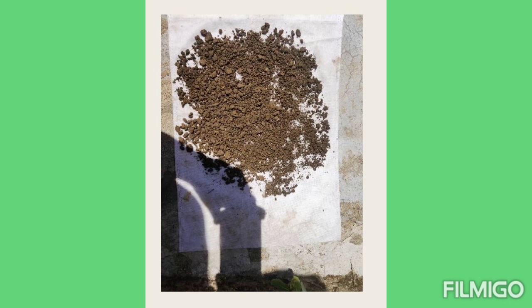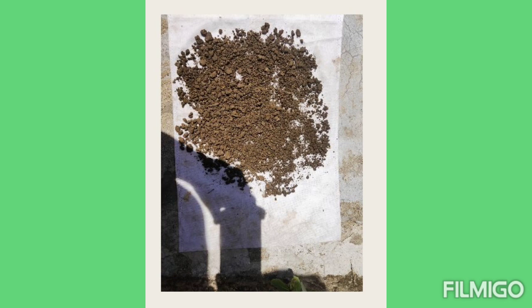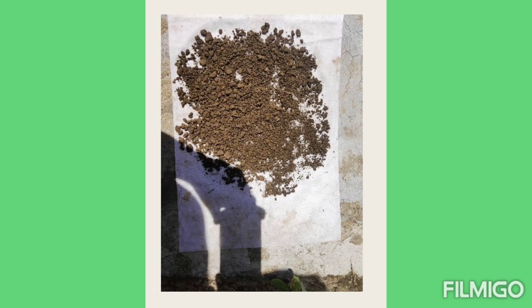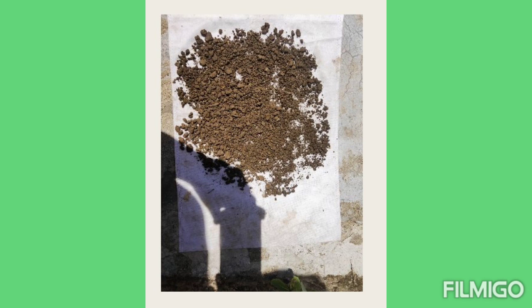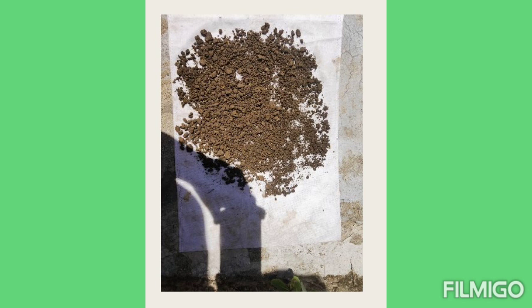Hello, good morning. Welcome to the second part of the Soil Science Practical. In the first part of the Soil Science Practical, we left the soil to sun-dry for one day.